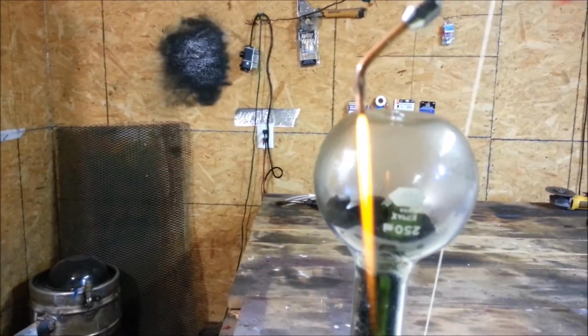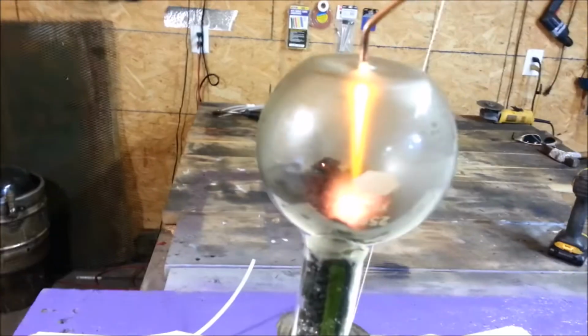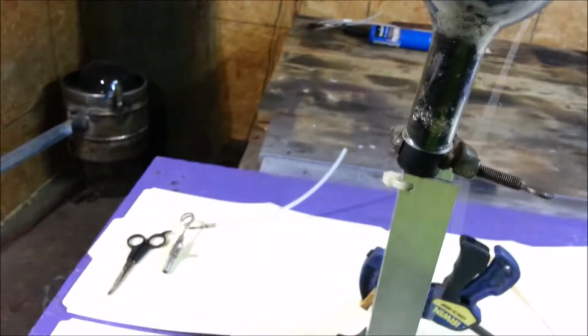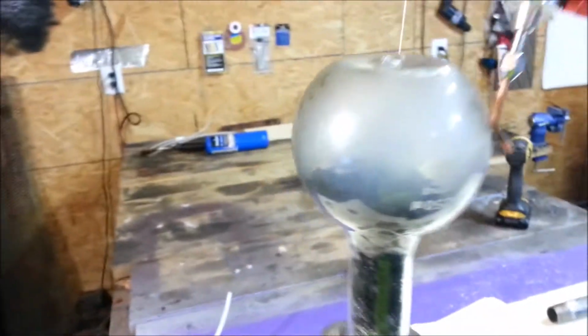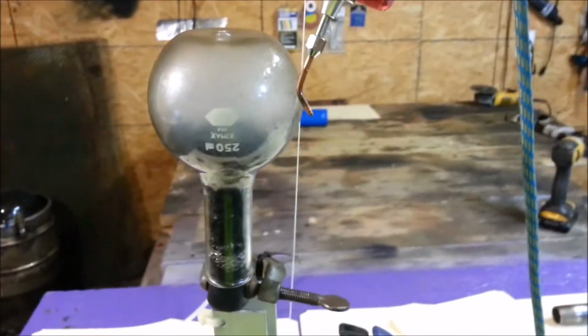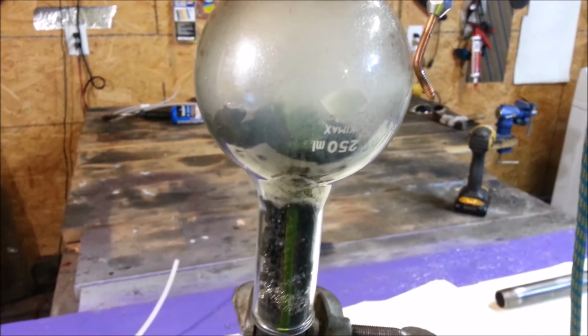As long as I want it to be, really. Here it goes. Okay, it's going out again. I don't think you caught that. Now I have to discharge that last little spurt of gases in there because I now have an explosive situation. So, I'm going to have to shoot some air in that line, clear the chamber. I don't know why it's going out. It shouldn't do that.